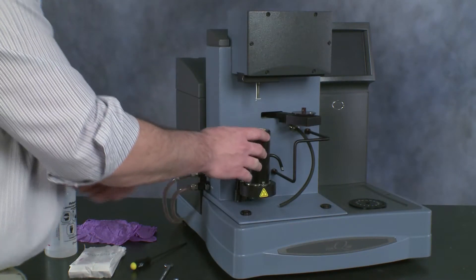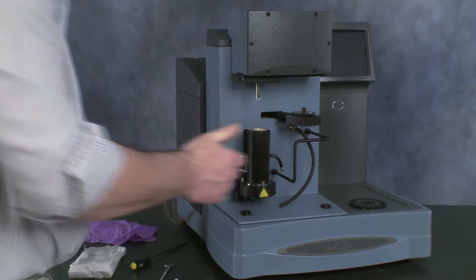We're now ready to lift the jacket off. Inside we have the ceramic furnace, so when we're lifting it we want to be careful not to damage the furnace.